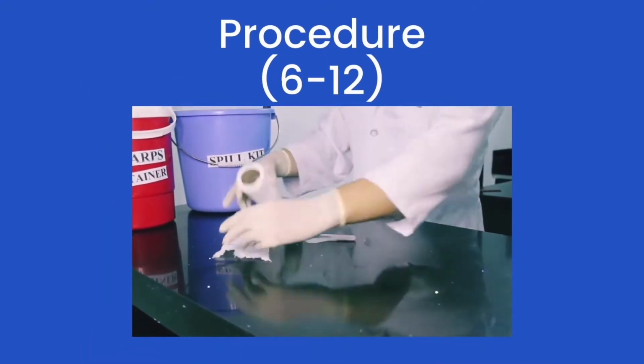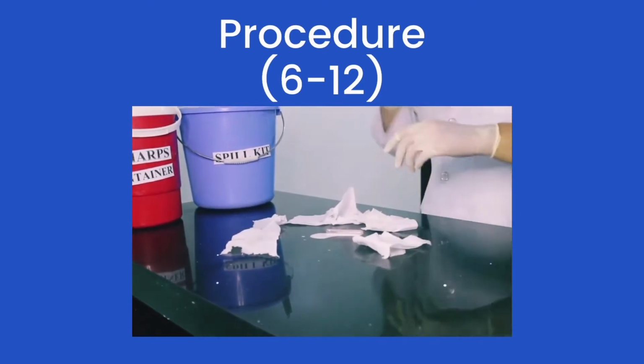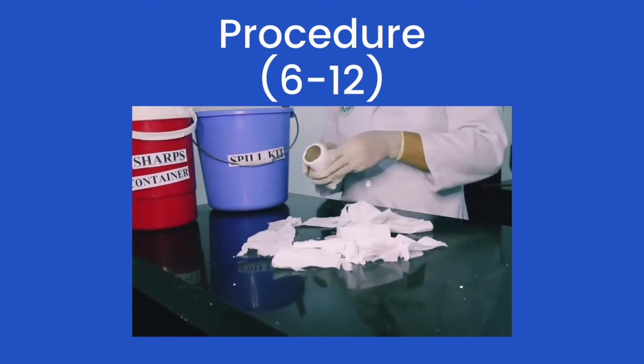We proceed to our step 6 and 12. For step 6, we have to don appropriate PPE and re-enter the area with our spill kit. And please remember to always go in pairs.